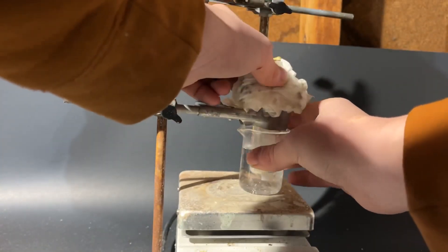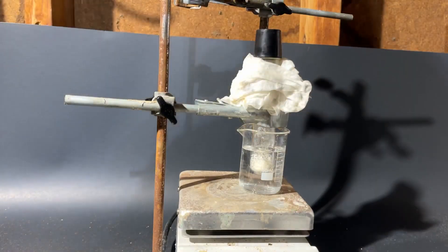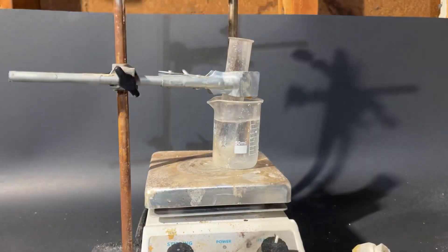So at this point, what I need to do is heat the mixture gently in a water bath until crystals deposit on the cooled part of the test tube. And this should be my ammonium carbonate.